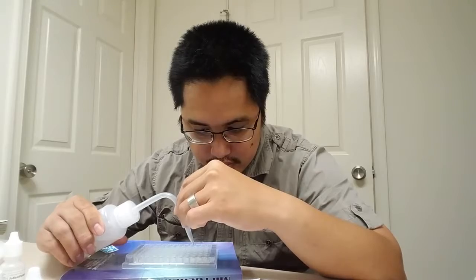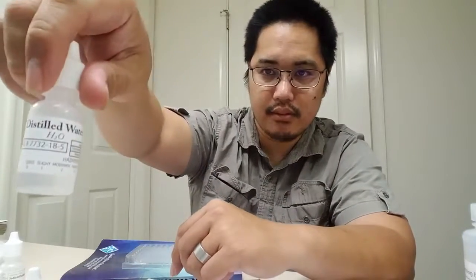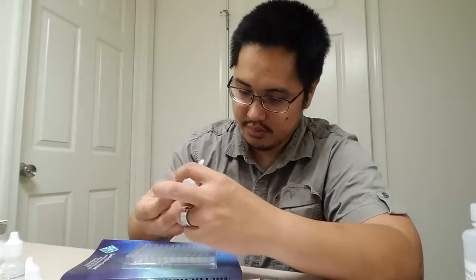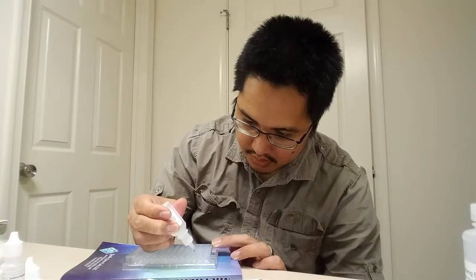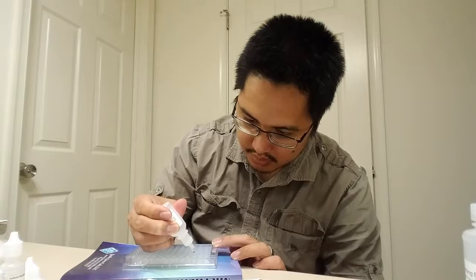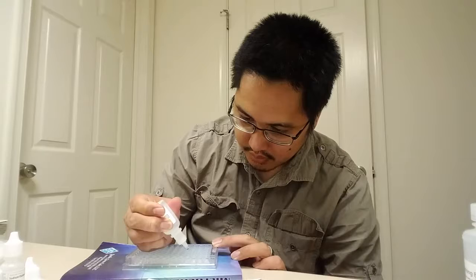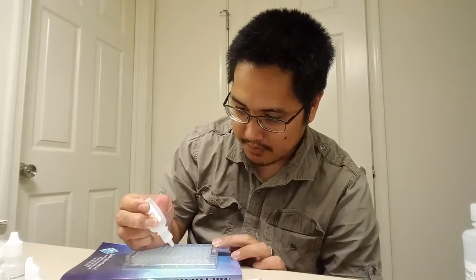There we go. To be honest with you, this is a lot harder to use than this one, and it's the same stuff. This is distilled water. 1, 2, 3, 4. 1, 2, 3, 4. 1, 2, 3, 4. All right.